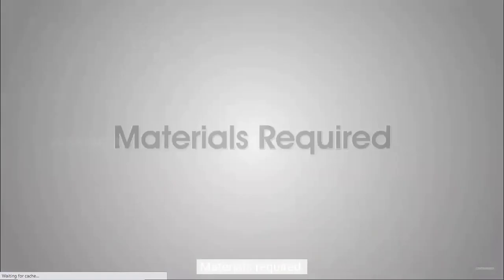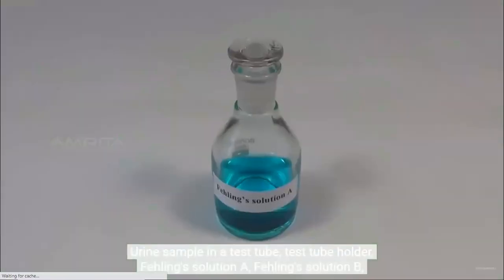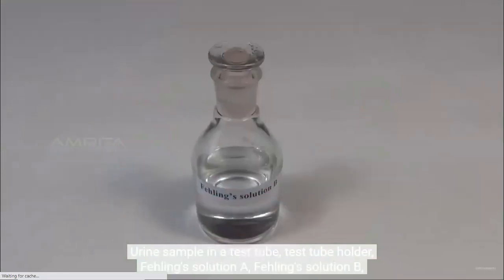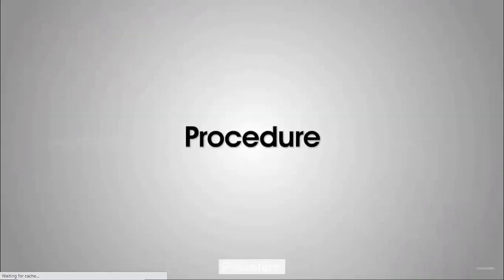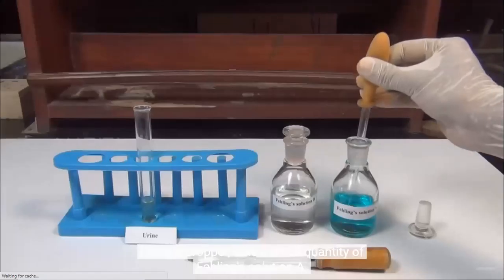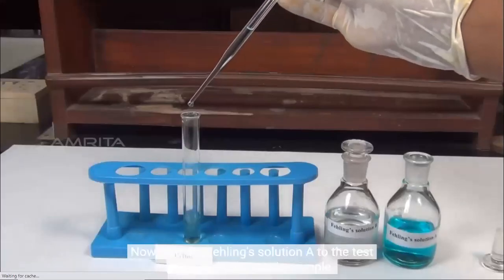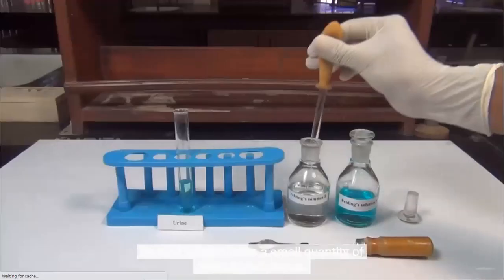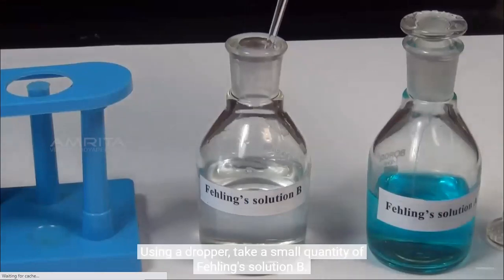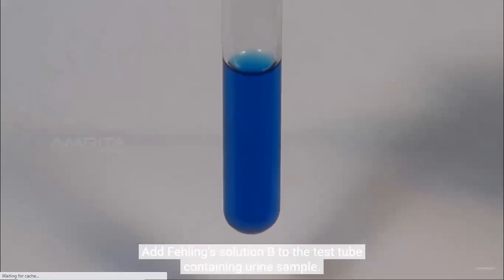Fehling's test. Materials required: urine sample in a test tube, Fehling's solution A, Fehling's solution B, dropper, and a burner. Procedure: using a dropper, take a small quantity of Fehling's solution A. Now, add Fehling's solution A to the test tube containing urine sample. Using a dropper, take a small quantity of Fehling's solution B. Add Fehling's solution B to the test tube containing urine sample.